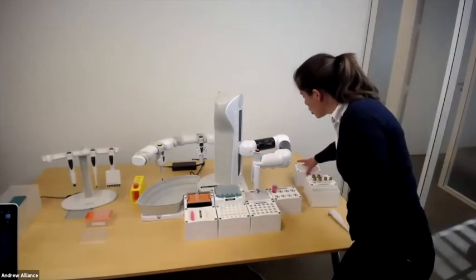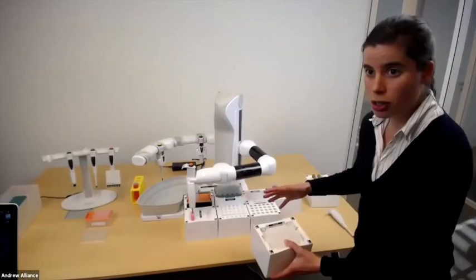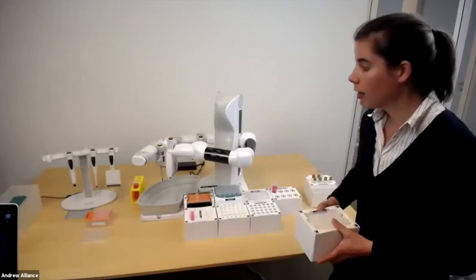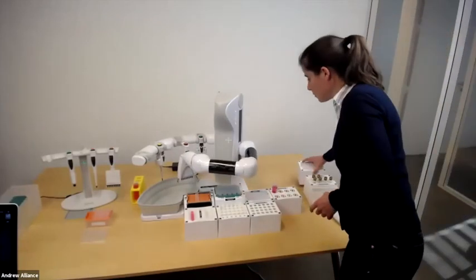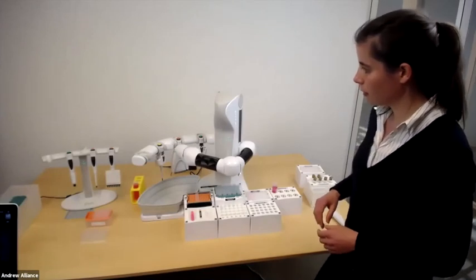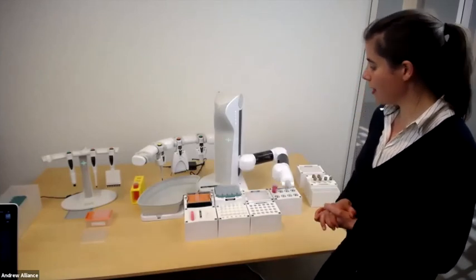All these dominoes as well, you see here, it's very modular, they're magnetic, so you can just click them to each other, change the direction. One day you can run an assay with 8 different microplates, the next day you can run 20 different tubes, fully modular, fully flexible. And he takes care here of just putting the pipette back, as he should. And now the experiment has ended.